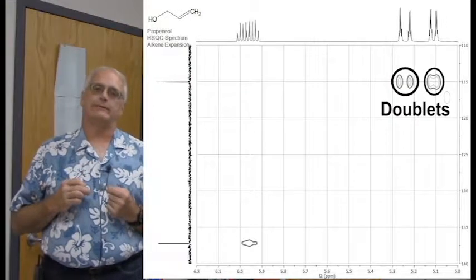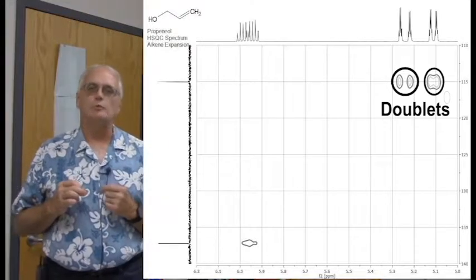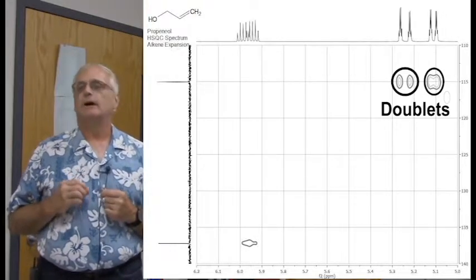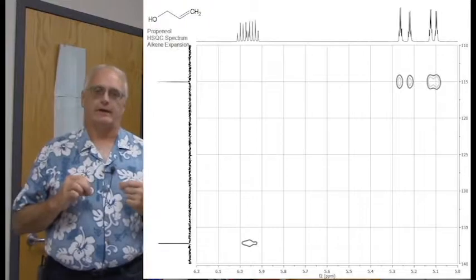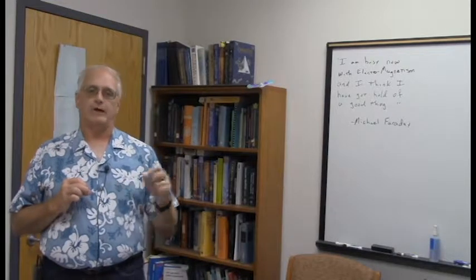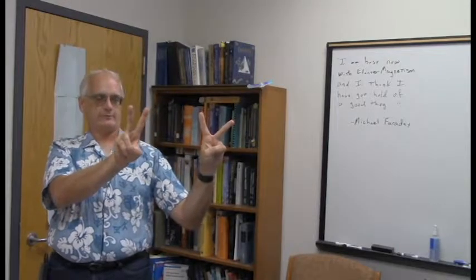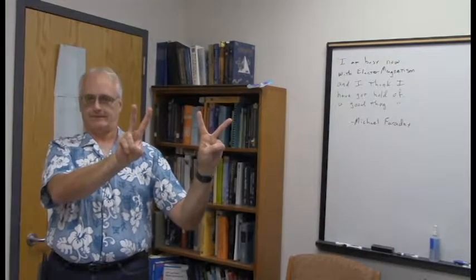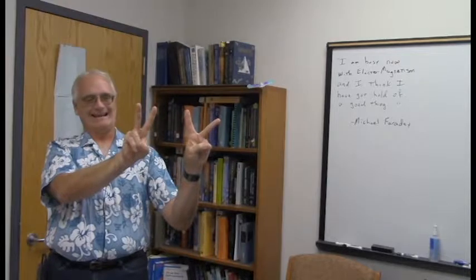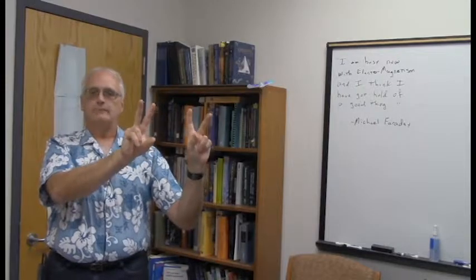You could even see it a little bit in the cis, although they're not resolved in the crosspeak, but you can see the crosspeak definitely has like 2 parts and kind of gets a little bit narrower there in the middle. So you can kind of see the doublet nature of both of them here quite nicely. Now I'm going to use this kind of patterning. I find students will sometimes find it useful. When we look at it, we have the doublet of the trans, the doublet of the cis, and I have to be careful that the cis coupling constant is smaller than the trans coupling constant, but they're sitting about like this, fairly nicely separated from each other. In the other examples, this changes quite a bit. So let's go on to the next one.